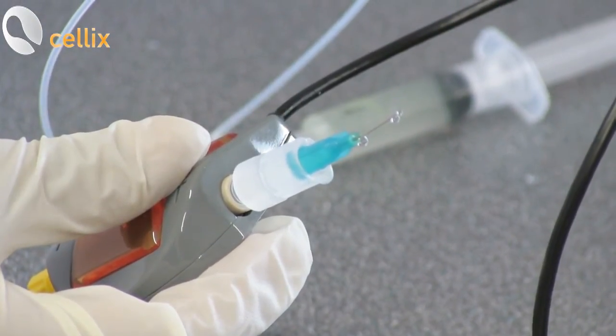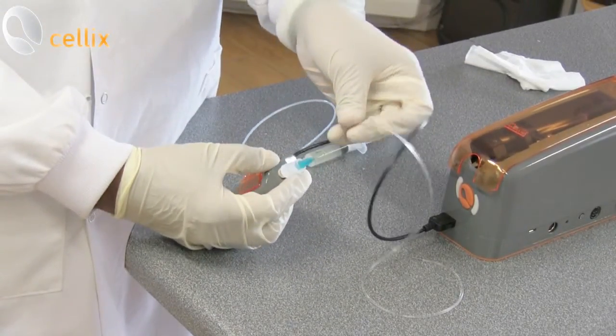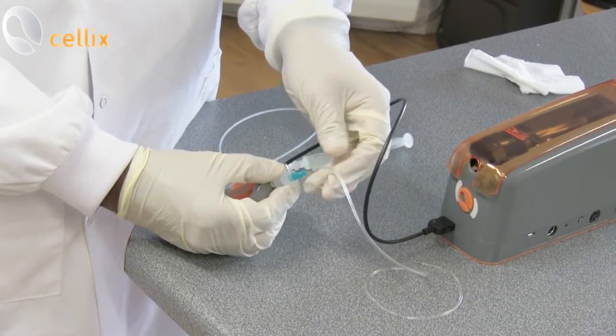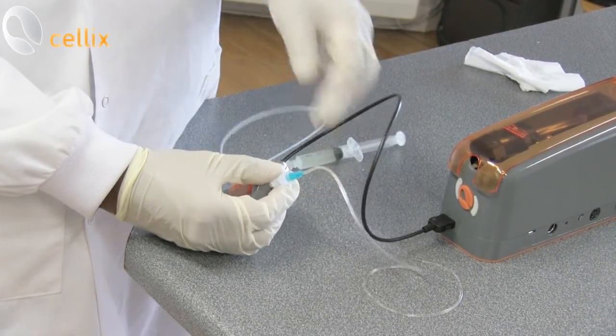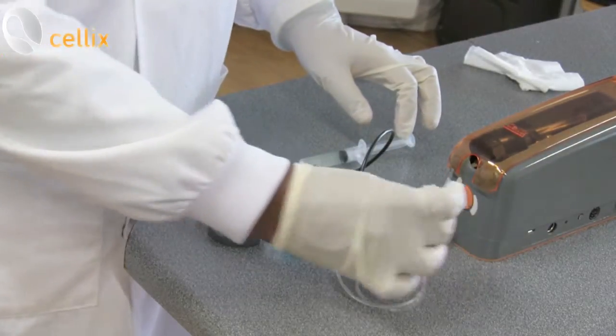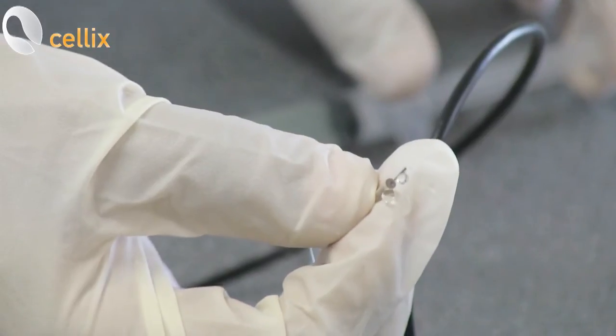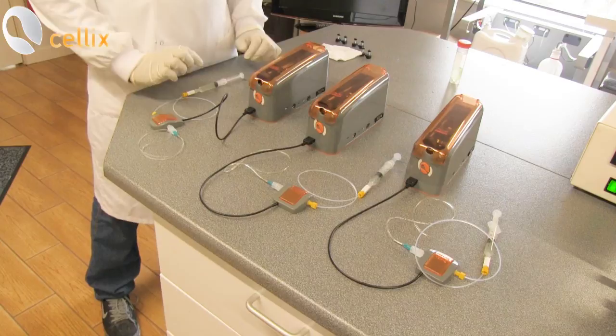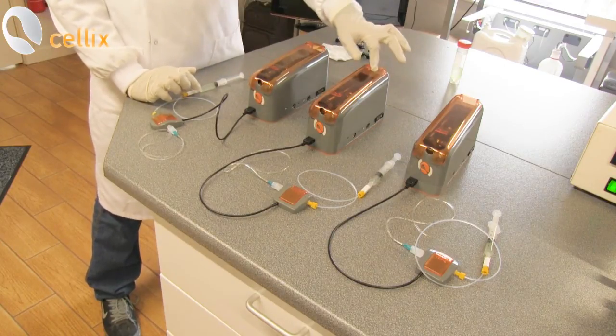Take this other tube and connect it to the blue connector. You have the pin on the other side. So you repeat the syringe setting for all three pumps.